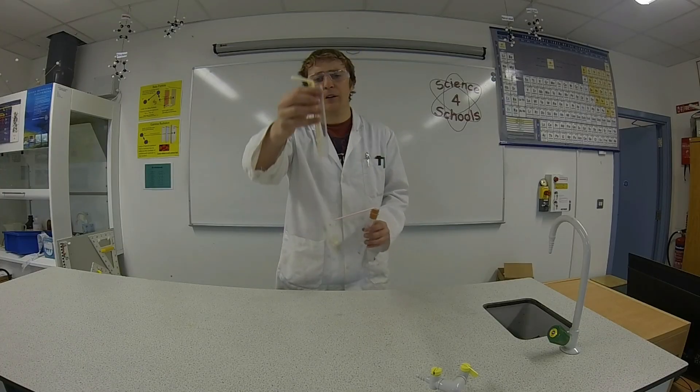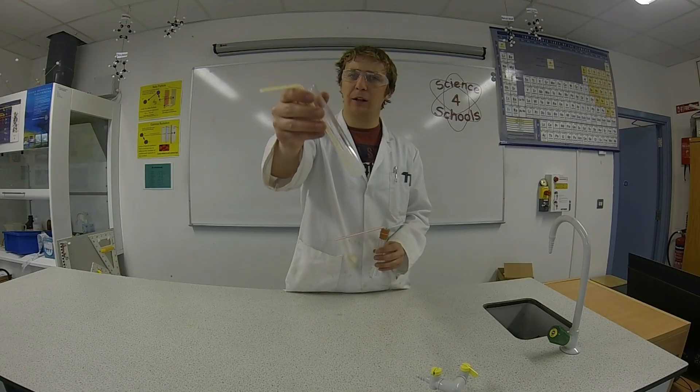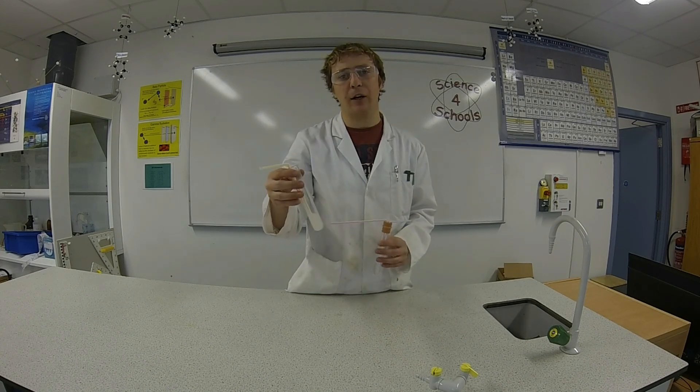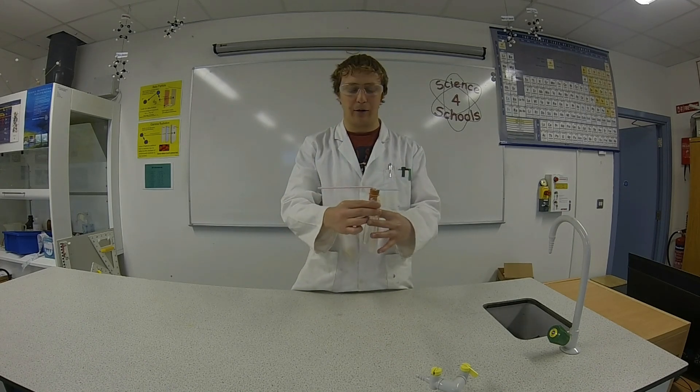You can see the lime water in this test tube has turned a milky colour, and that shows that there's carbon dioxide present in the exhaled air.